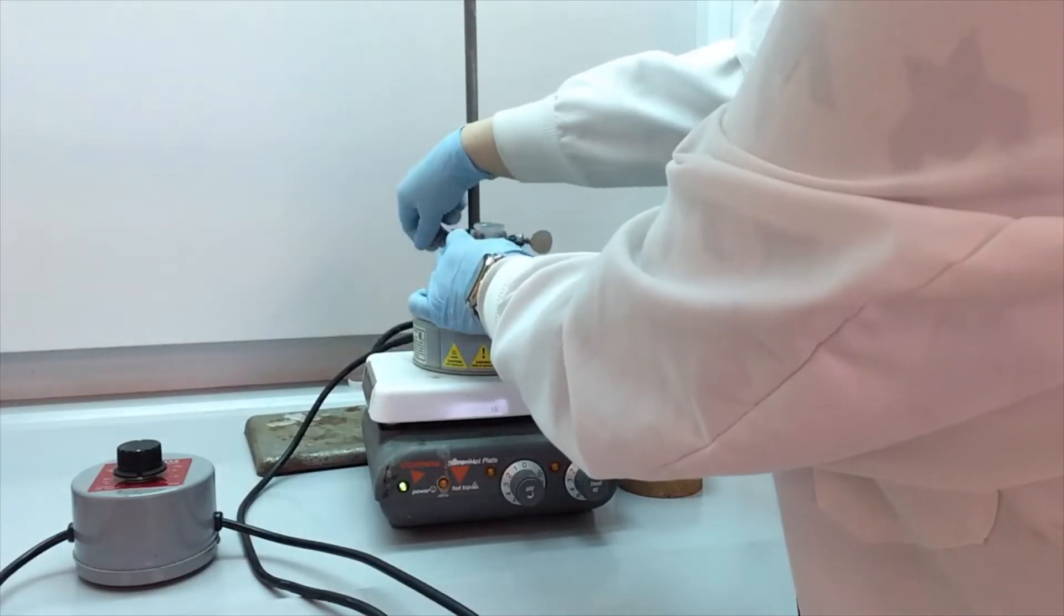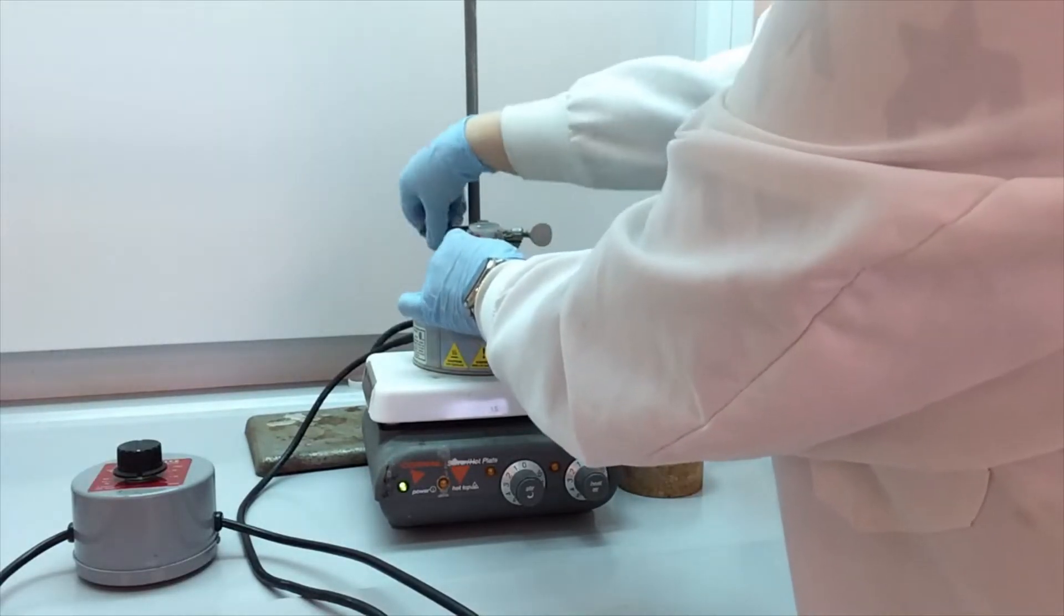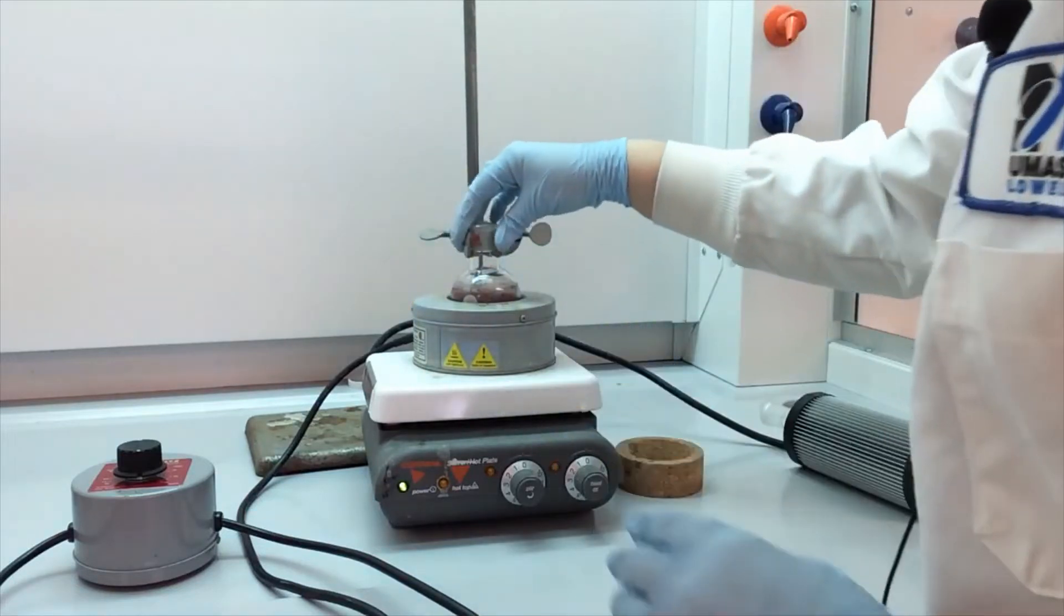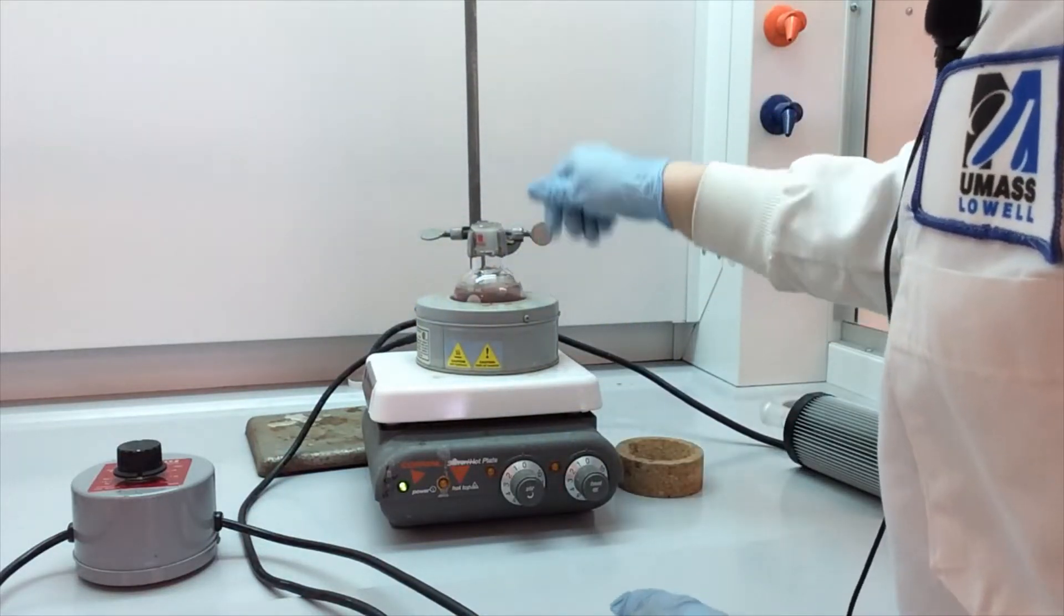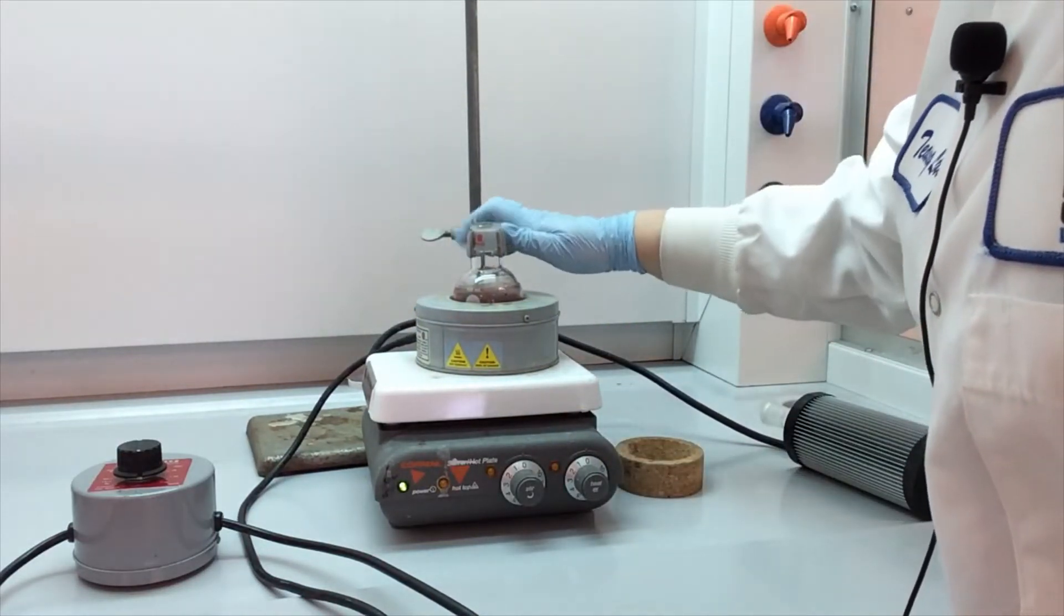So if you do this correctly, you just need one clamp. So that's tight. I have tightened this. It's very secure.